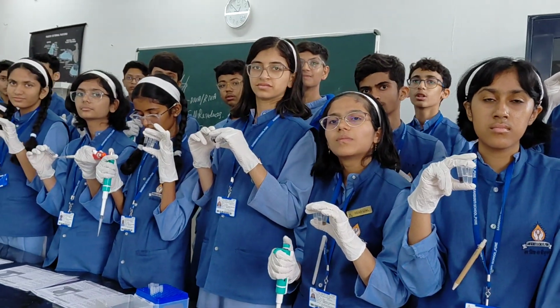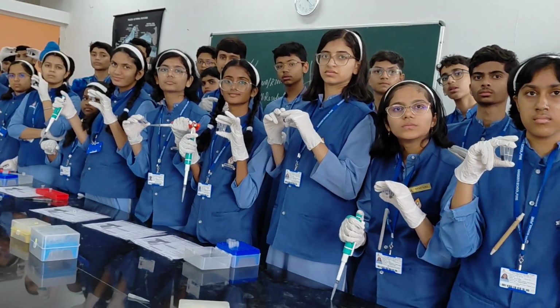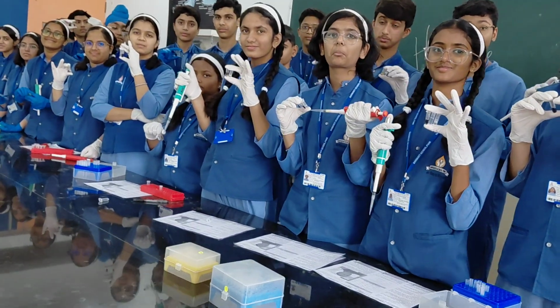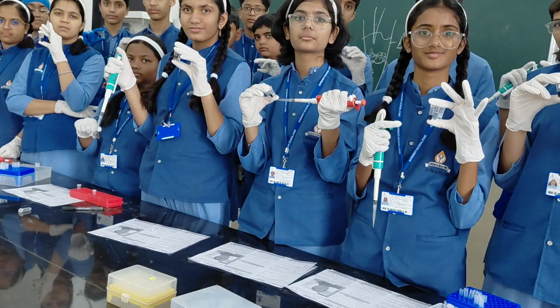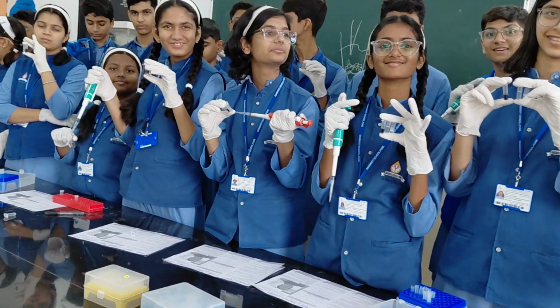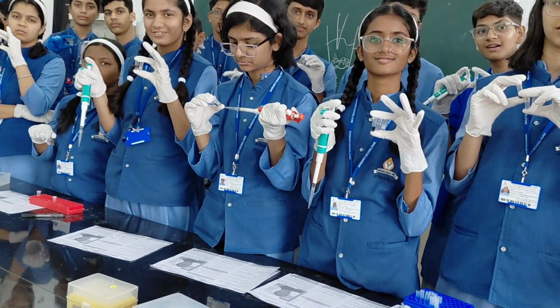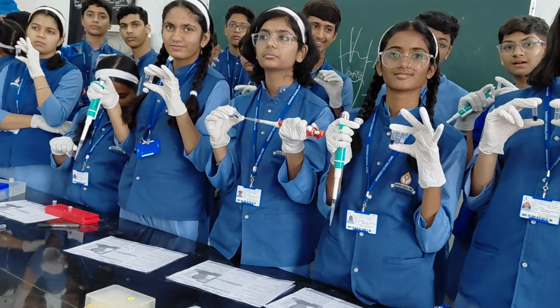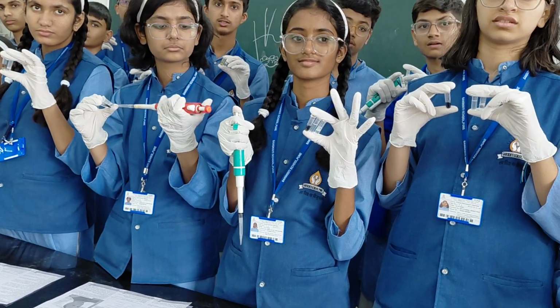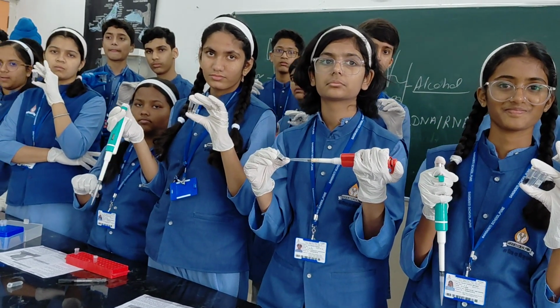But in one day, you isolated well, your performance is good, your supernatant transfer is good, and better than master's students and graduates in Maharashtra itself and also in the country, right? So whatever we are doing at school level, it's awesome and better than what college campuses do. Many campuses do not provide even a single sample to do the experiment. Here you did it individually, and whatever was missing, wrong, good or bad, that is a good experience to learn from.